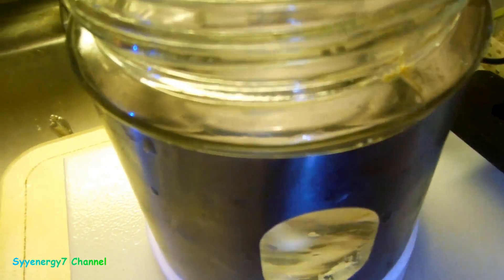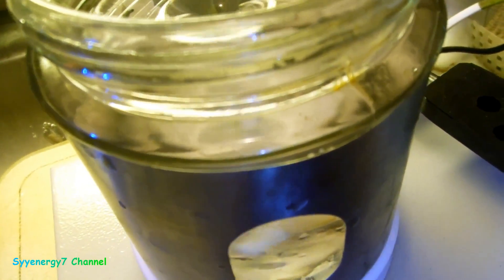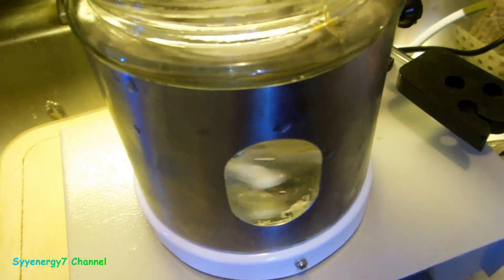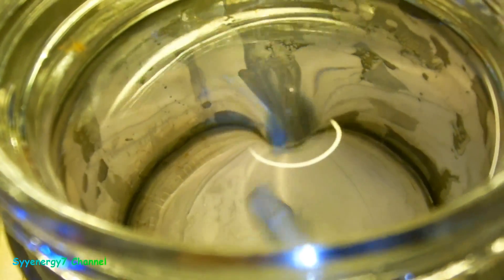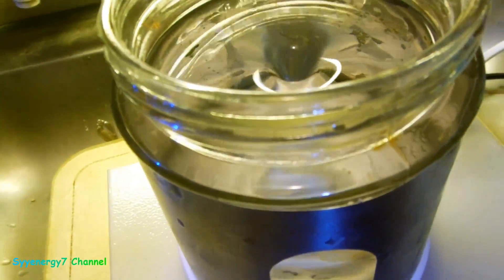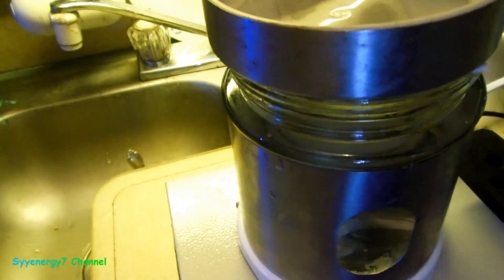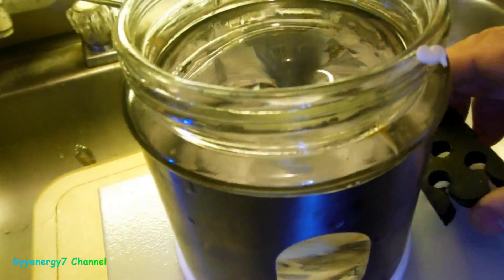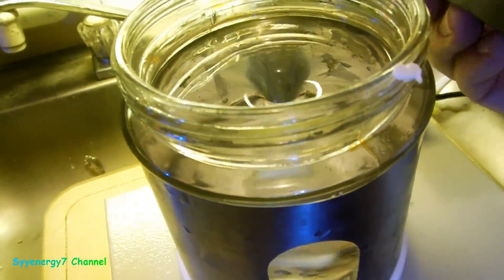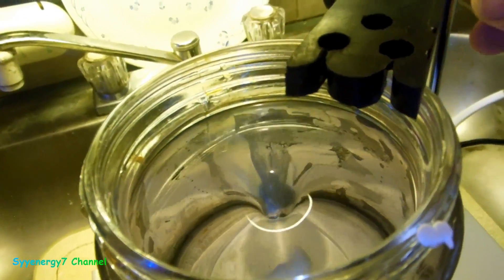And of course, if I have this thing here since this is stainless steel, I have to make sure this goes in the middle. Once it starts it's fine. Okay, I don't think this would even slip off. I don't even need this on top of here, but you know, it doesn't affect anything. Stainless steel has some magnetism in it and I was wondering if this would work, but since it has a glass bottom, it's pretty damn good. And even at low speed, see the swirl?